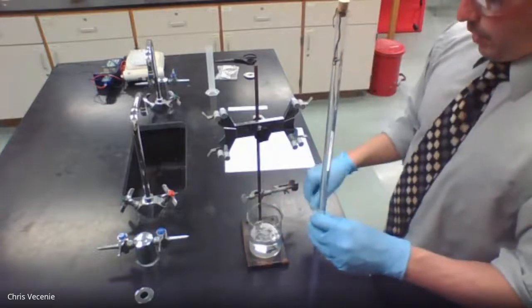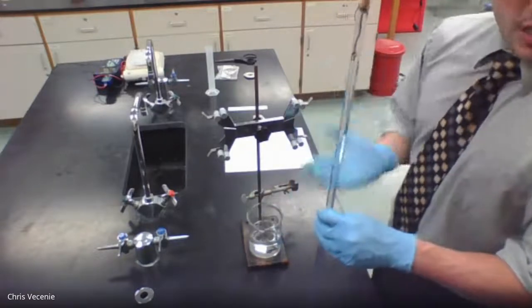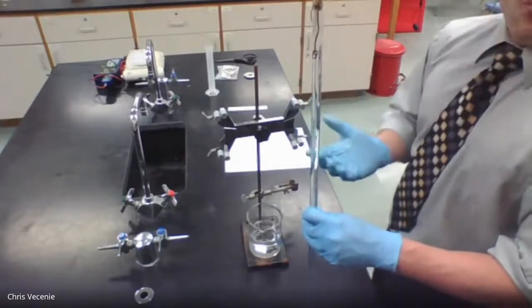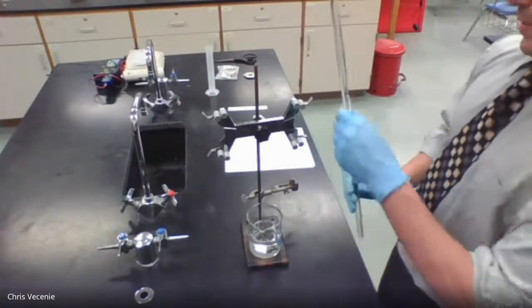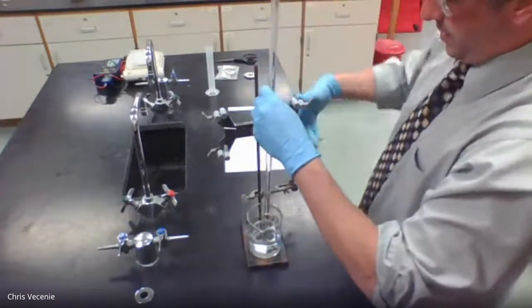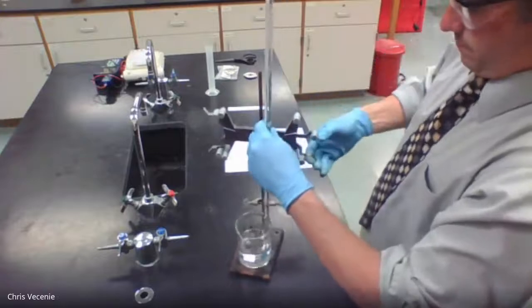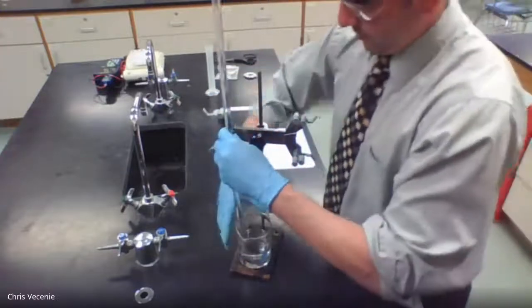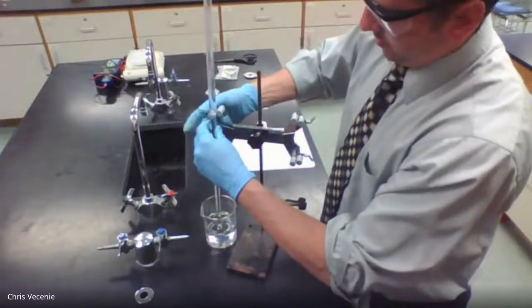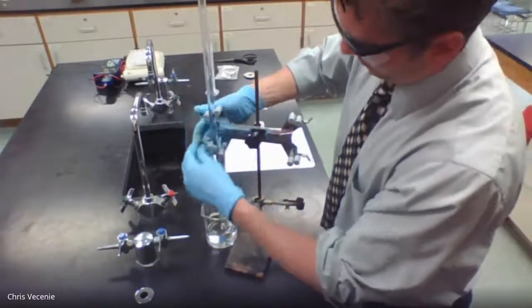And I'm going to plunge him into the water just to equalize our pressure so my cork doesn't pop out. And then what we'll do is we'll see what's happening with our reaction. So I'm going to flip this guy over, and nothing needs to be done super fast. Take my time. Move my beaker to where I can get my tube in.